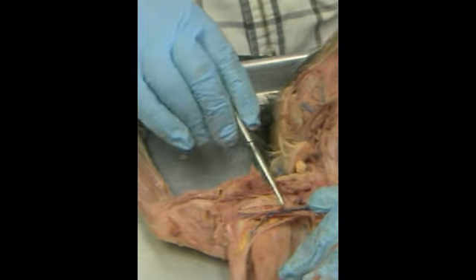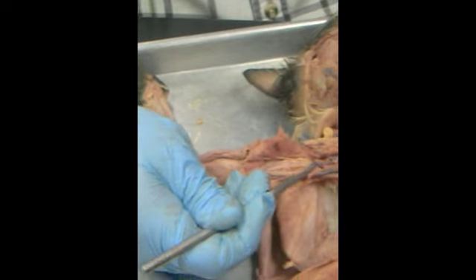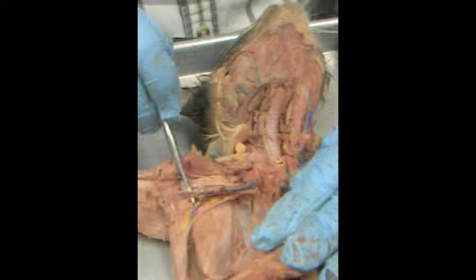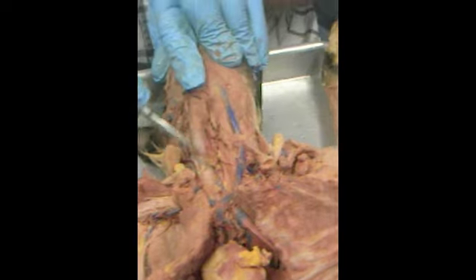The subclavian will have a blood vessel that dives down deep, right here, under the scapula. So it's called the subscapular. Once that comes off, this is now called the axillary. And then this will become the brachial. The jugulars go up, you can see it here, external jugular, internal.